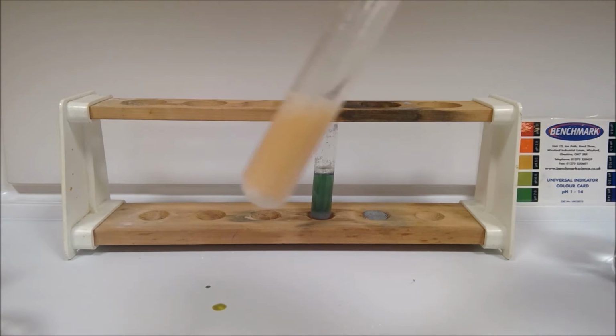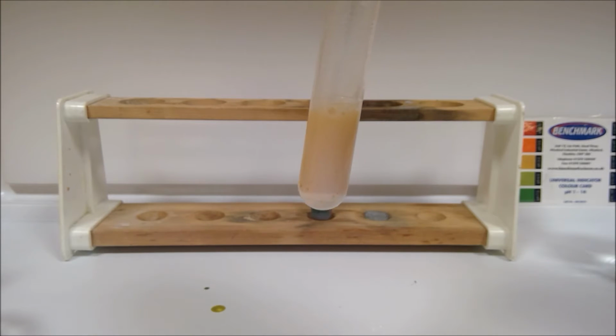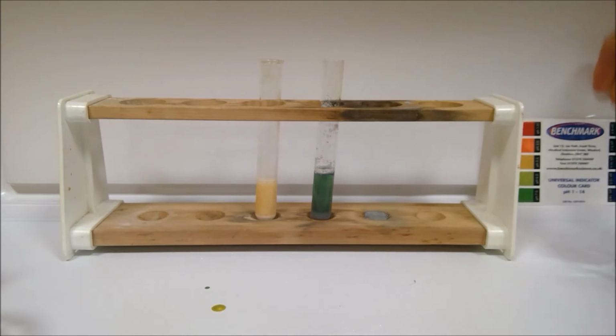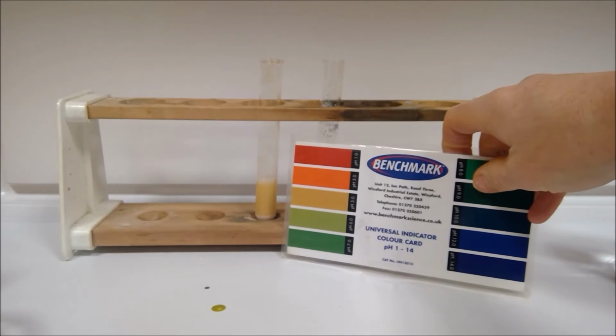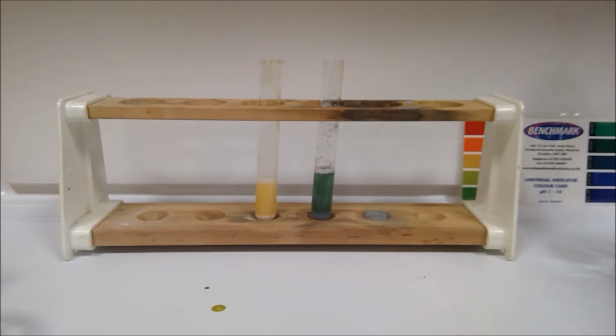Now it's quite cloudy there because of the zinc oxide that hasn't reacted. So we'll let that settle out a little bit before making final conclusions about the actual colour. But hopefully we can see quite straightforwardly the change from the red colour initially. I'll also just take a minute to heat both of these, just to ensure we get the maximum amount of reaction possible.